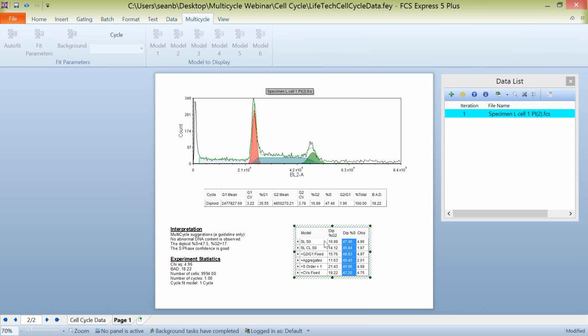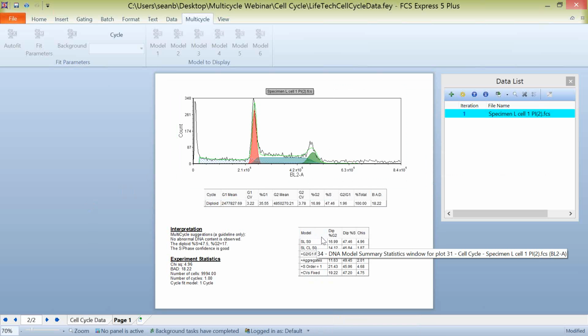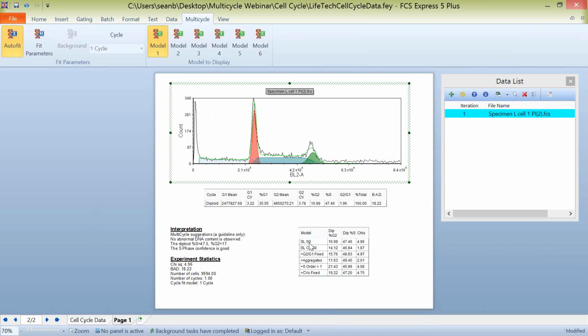Now, when we're working with our DNA model summary statistics, which are located in this table, what this table is referencing is that each one of these models is one of the models to display that's located in your multi-cycle tab here. So there's 6 different models. They're listed in order here. SL S0 is model 1, going down to our CV's fixed, which is model 6. And as we change between our different models here, using the multi-cycle tab, we can see how these models are adjusting on the data analysis itself.